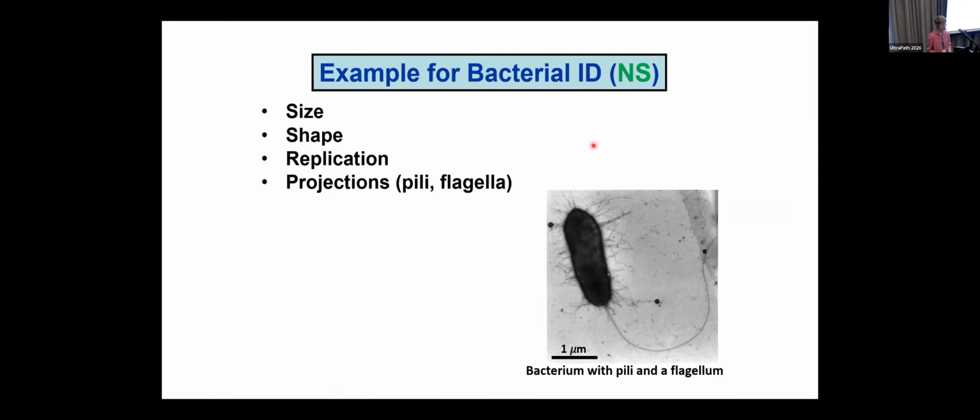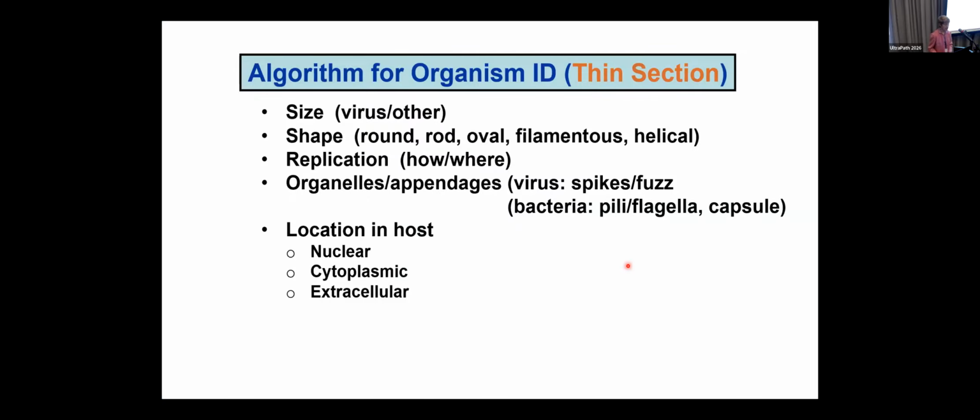Here is an example of a bacterium seen from stool, and you see that it quite nicely demonstrates the pili, these little short, many-armed things. And here is a flagellum. So there's no question that this is a bacterium that we saw in a stool sample. Moving into the next technique, thin sectioning. Here are algorithms for looking at organisms by thin sectioning.